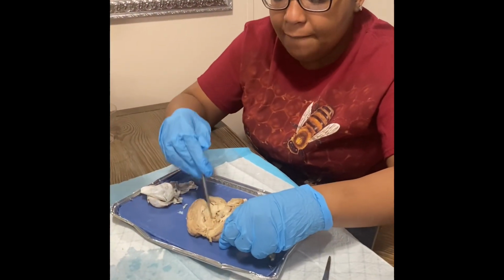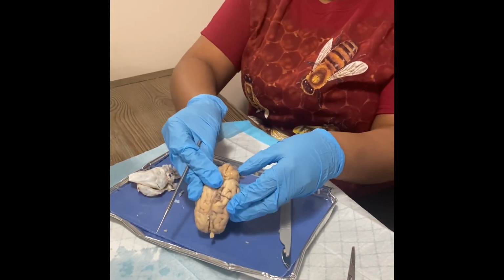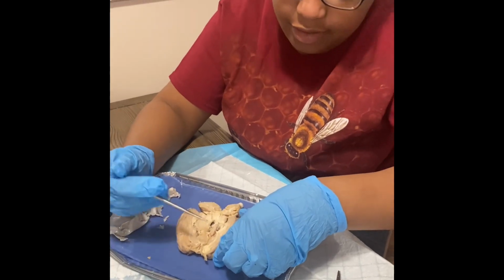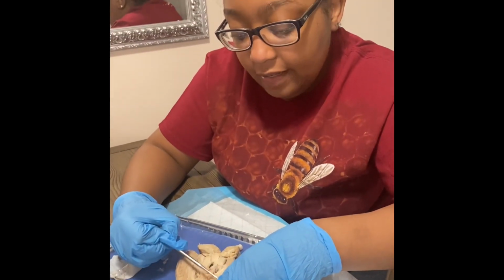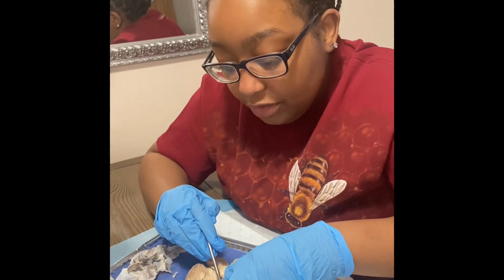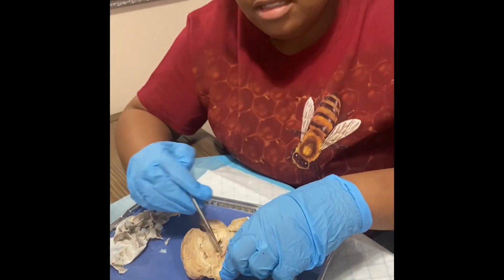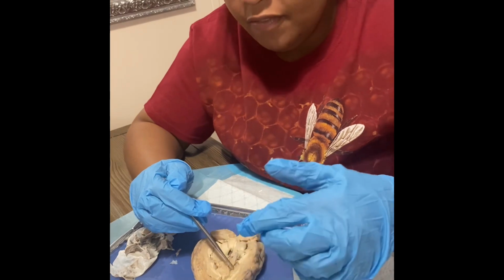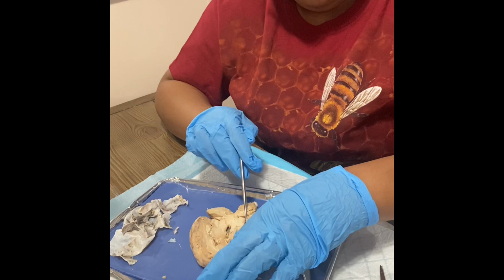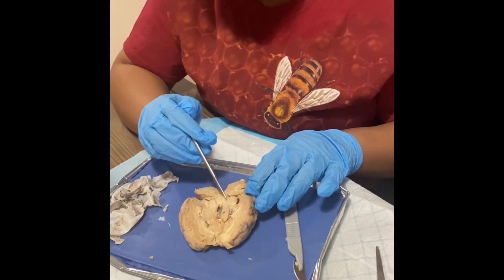Now I have done a mid-sagittal cut, which is a cut right through the middle of the brain. And then we have the cingulate gyrus, which is right here, is like the second layer of like connective tissue in the brain. And then we have the lateral ventricle, which is right here in this depression. And then you can tell it's the ventricle because it has the space for blood vessels to flow through. And then we have the third ventricle, which is right here. And then we have the tegmentum, which is right here.